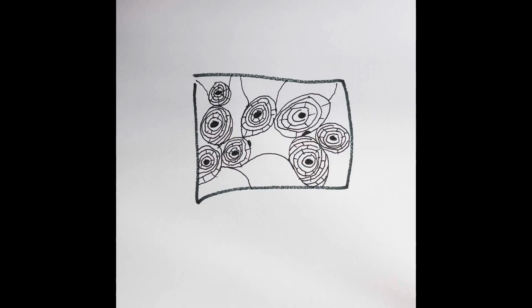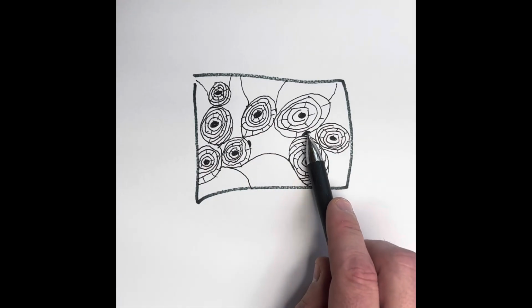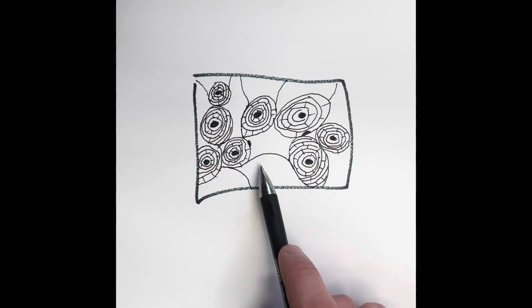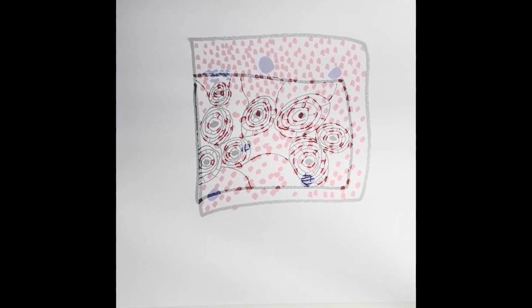All right, now we're moving on to bone connective tissue. It's hard in nature, but flexible due to the minerals and collagen. It has osteocytes, which are located right here, and also right here. These are bone cells. They leverage movement from muscles to project movement. They are also utilized in the protection of internal organs and mineral storage as well. Bone cells can be found in the skeleton.